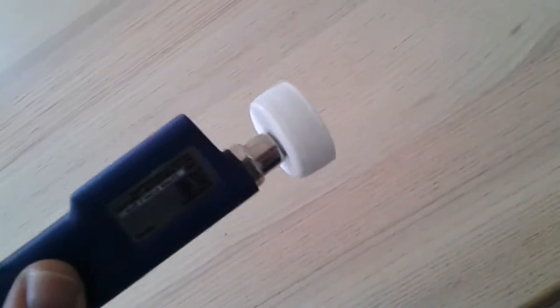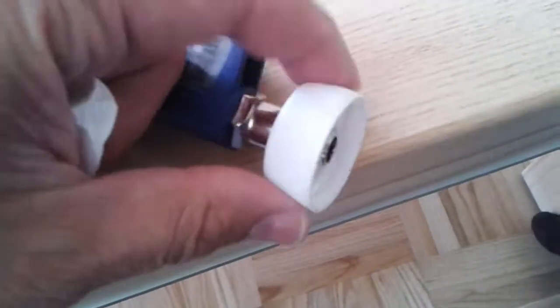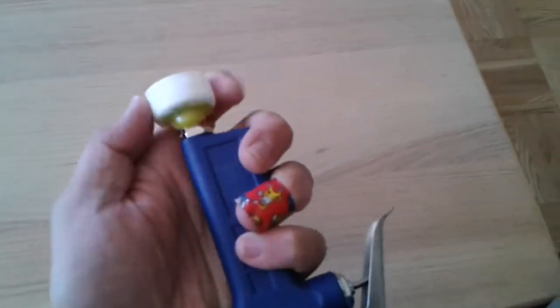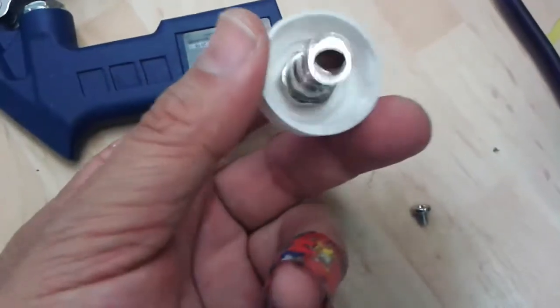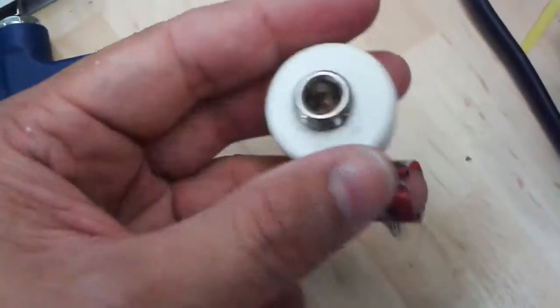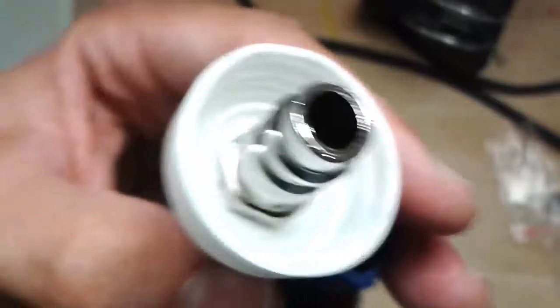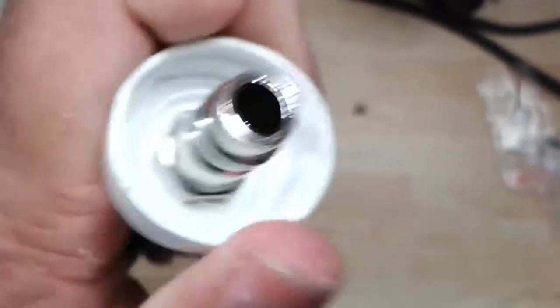In the process, I hurt myself a little bit. Okay, and now the next thing is I have to use a glue gun or some silicone to make the whole thing airtight, because this here is not airtight yet, of course. Okay, total failure. It's not airtight. I can even turn this here. So I have to find a different solution for making this airtight. I now managed to detach the connector, and I made the hole a little bit bigger. And now I'm going to try to connect it directly like this. Okay, this is now how it looks. I really made it very tight. It's very stable now. I'd be surprised if any air could go through.